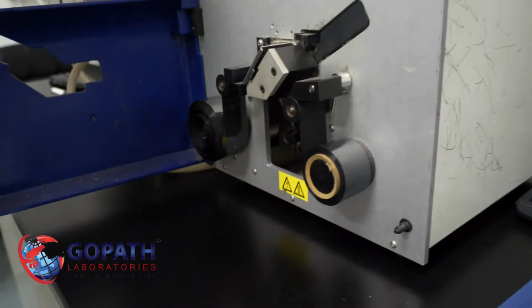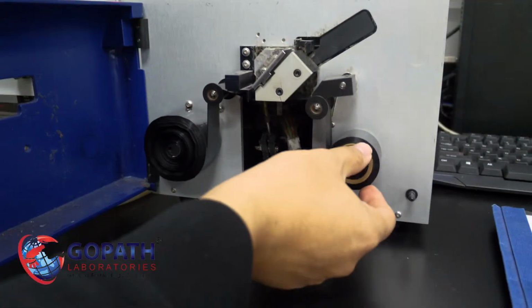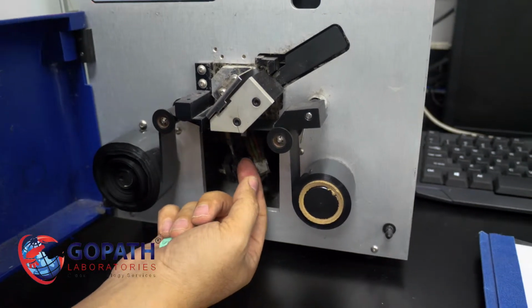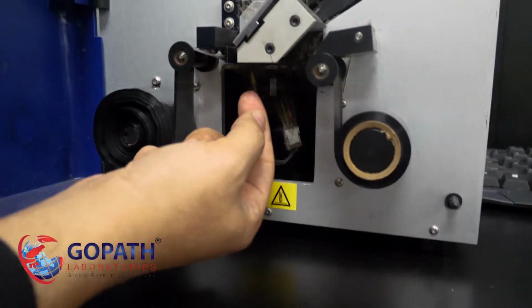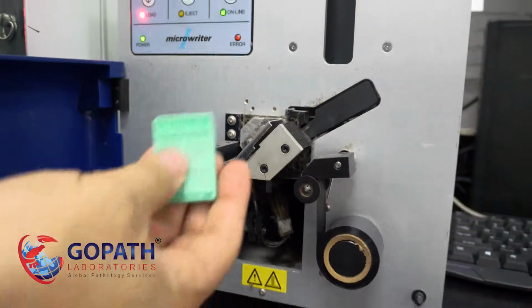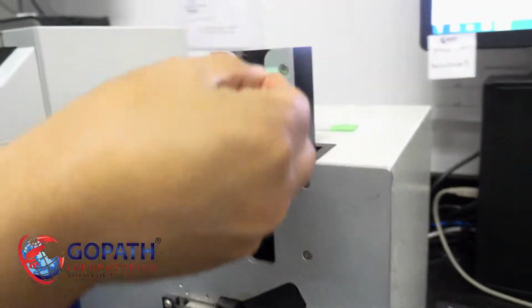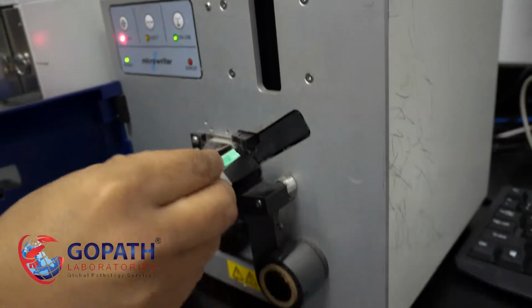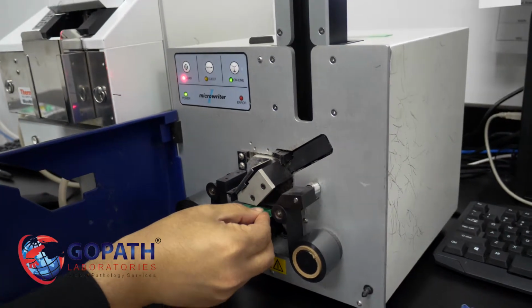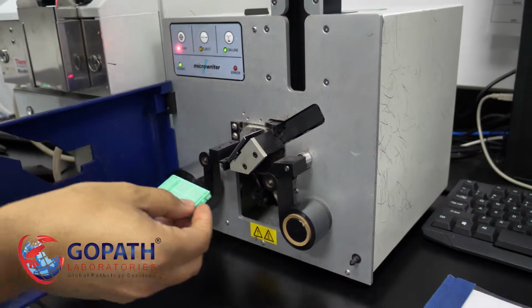I think that's the area which has two ribbons. This is the brand new one coming here, and the needle comes here and starts printing on it, and this is the used ribbon. So when we are loading the slides here, slides come from here and then come here, cassettes, and start printing, and then come out. So we're going to show how this works.